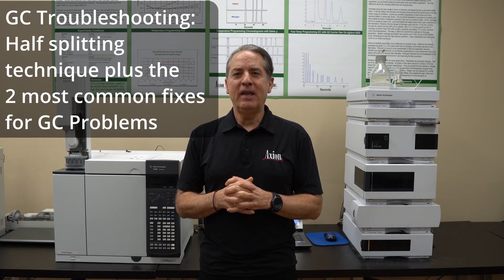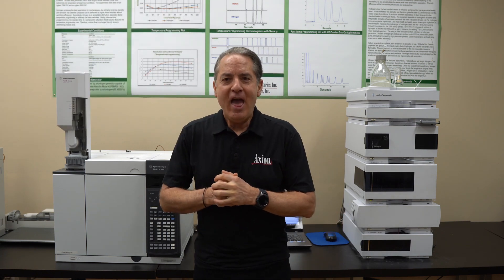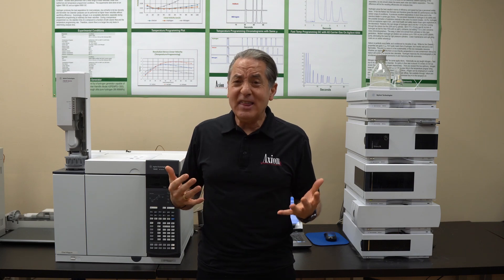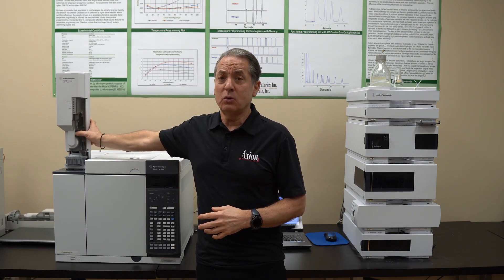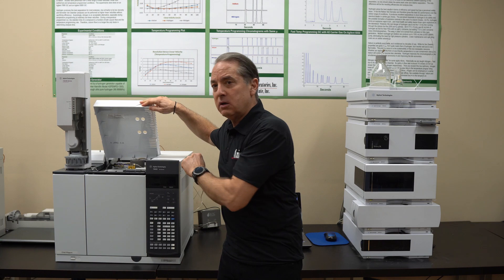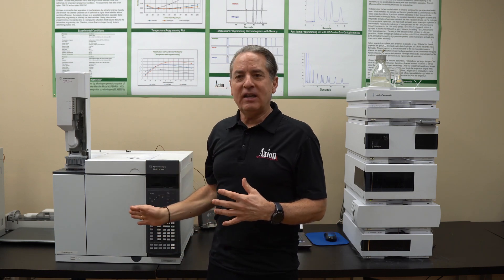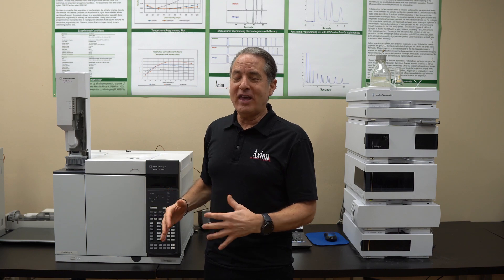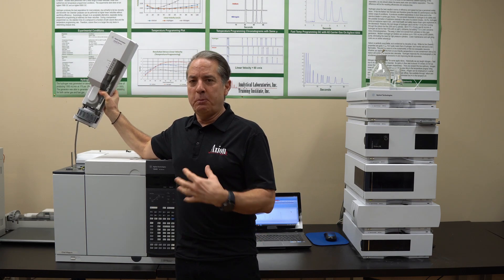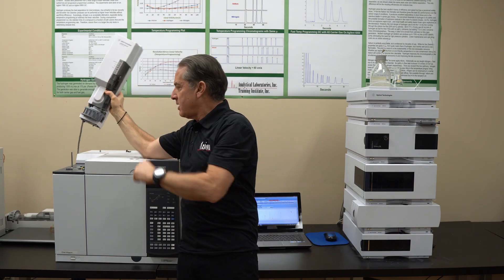I'll give you a little troubleshooting on the most common problems in a GC. Let's say you make an injection and you get nothing — not a single thing, just a flat line. What's wrong? It could be anything: your auto sampler, the inlet, the column, the detector, or the data system. So how can we figure out what it is? I'm a big fan of what's called half-splitting. I can do things like remove the auto sampler and make a manual injection to see if you get peaks. If so, you know you have an auto sampler problem.